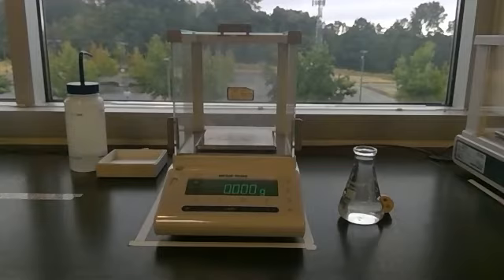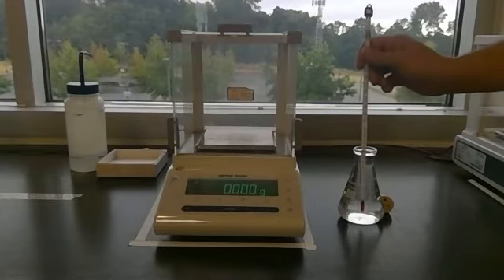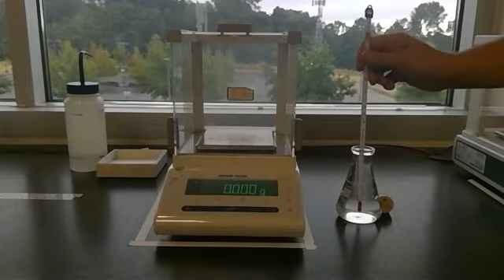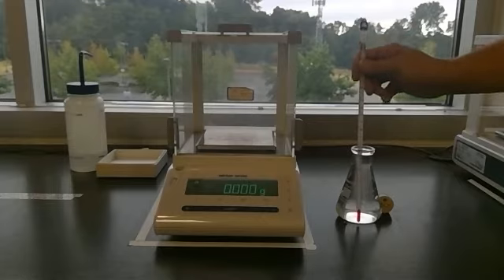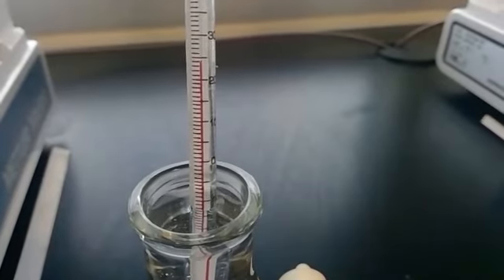The last piece of information we need to accurately determine the volume of water that we have is the temperature of this water. Density is temperature dependent. So we're going to use the mass and the density of water at this specific temperature of water to determine the actual volume that occupied our flask. And so I'm letting this sit in here for a little bit. Pardon my adjustment. There we go.